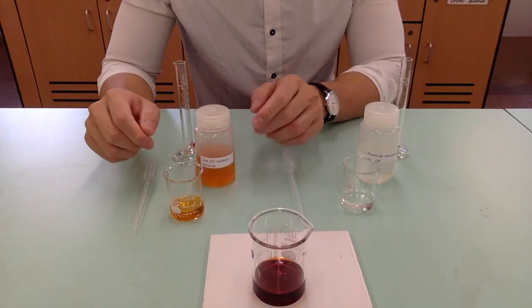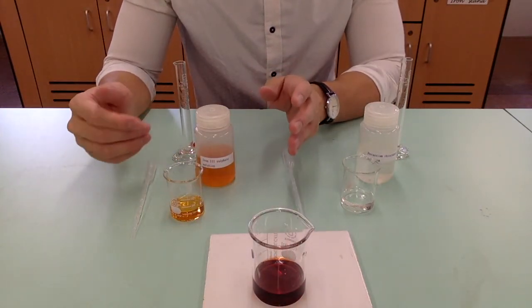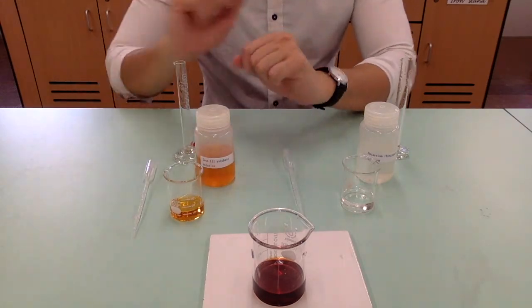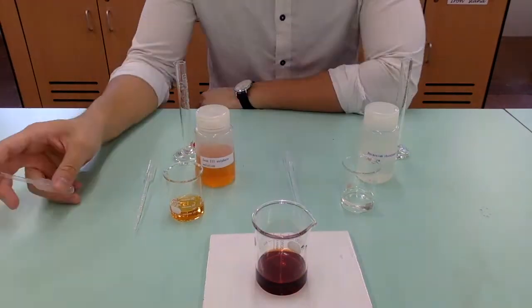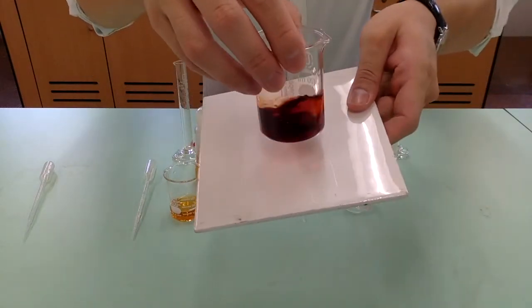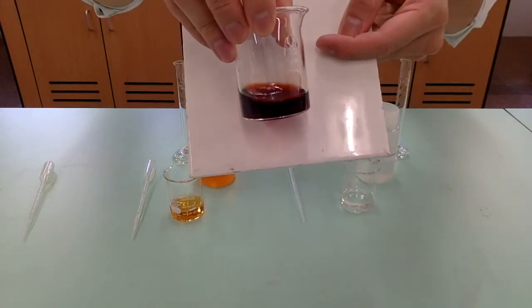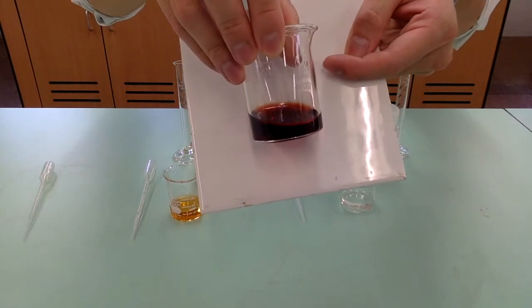We will wait one minute to allow the equilibrium to attain. Now, one minute has passed. You should record the color of the equilibrium mixture.